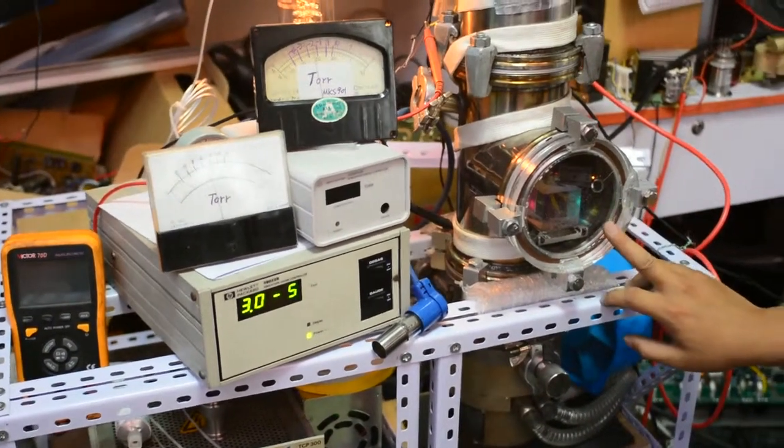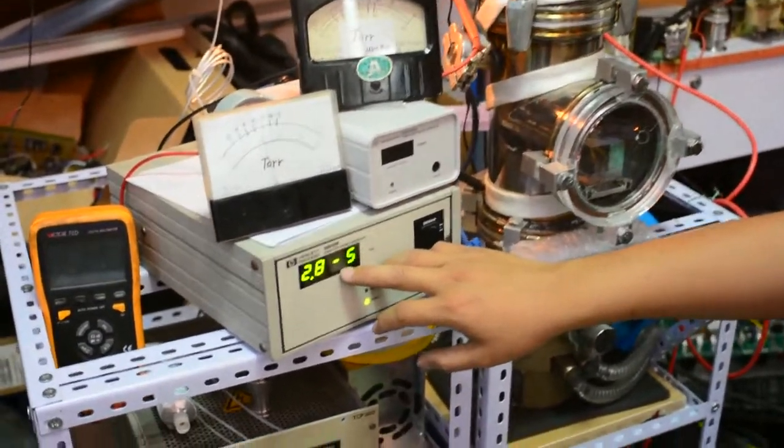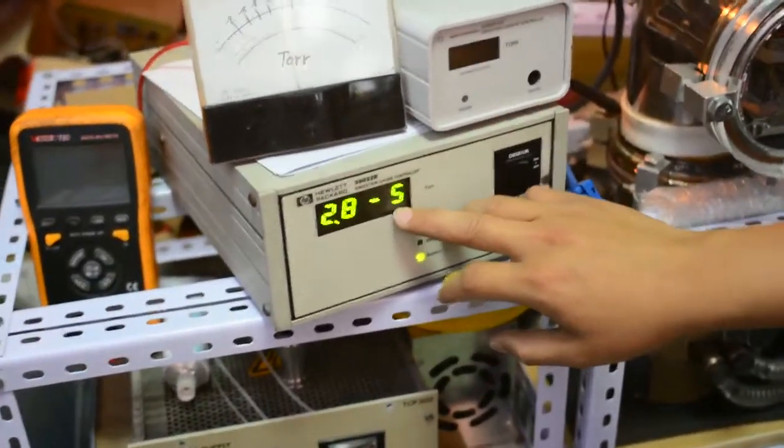There is a lot of room to trap a lot of the moisture and other gases. You can see it is back to the low pressure level.